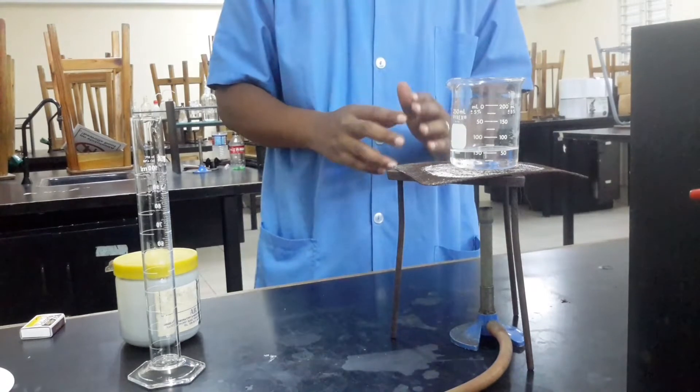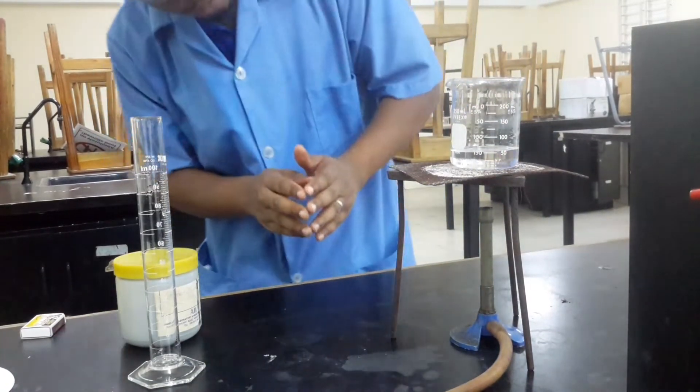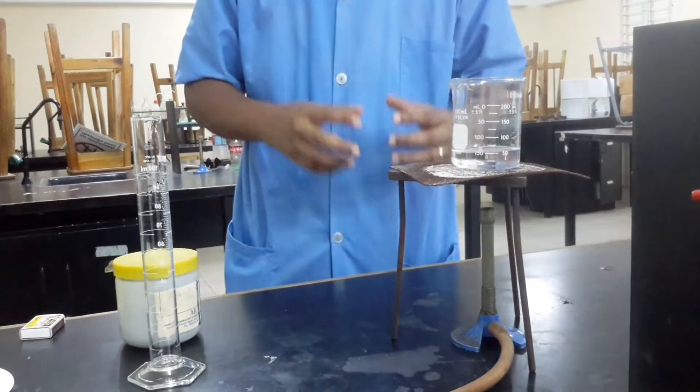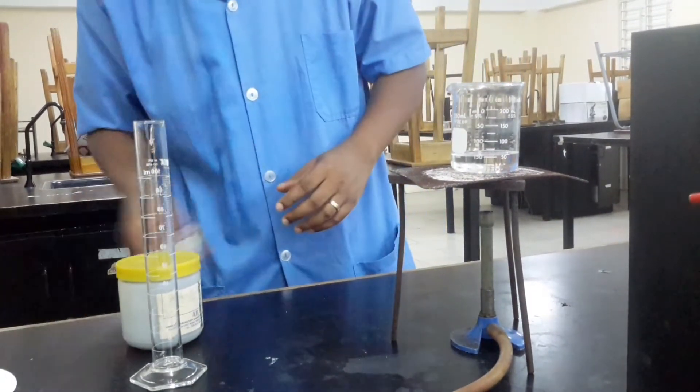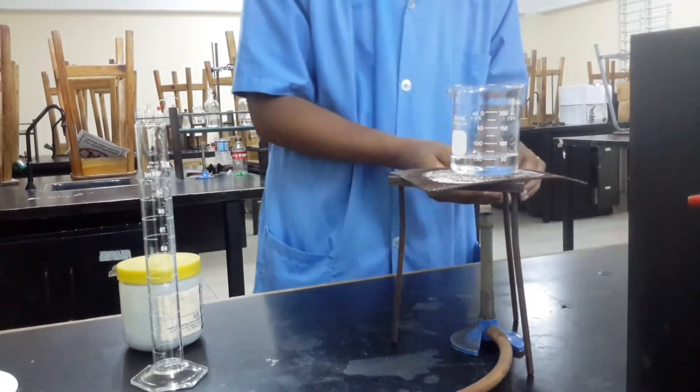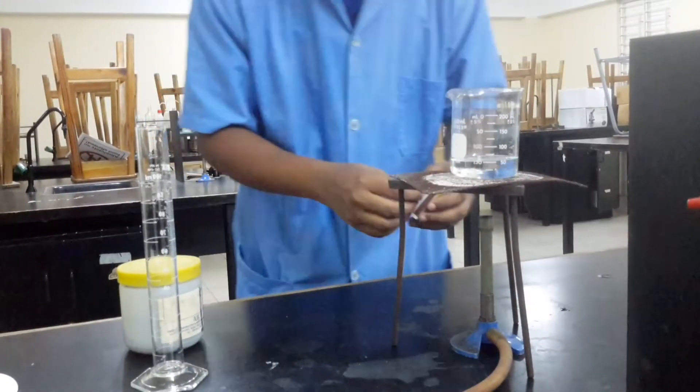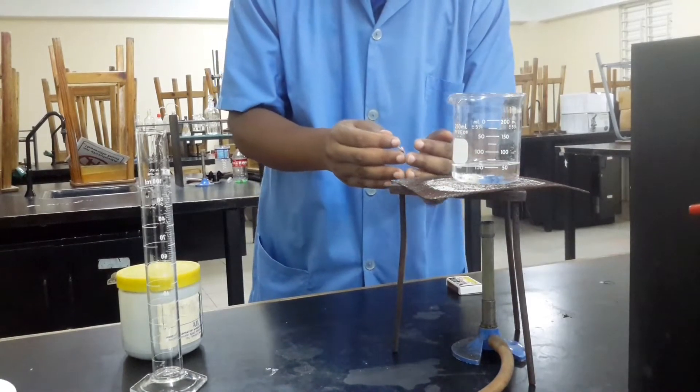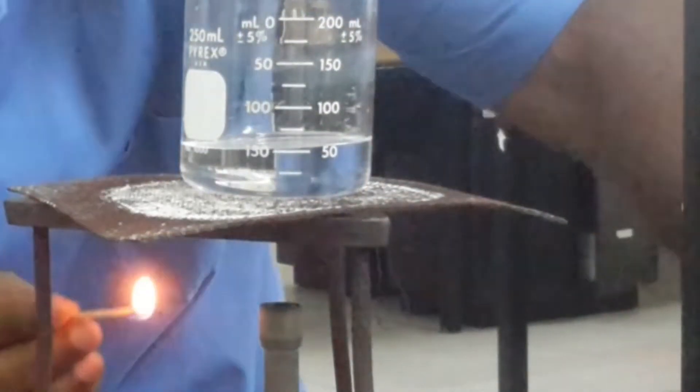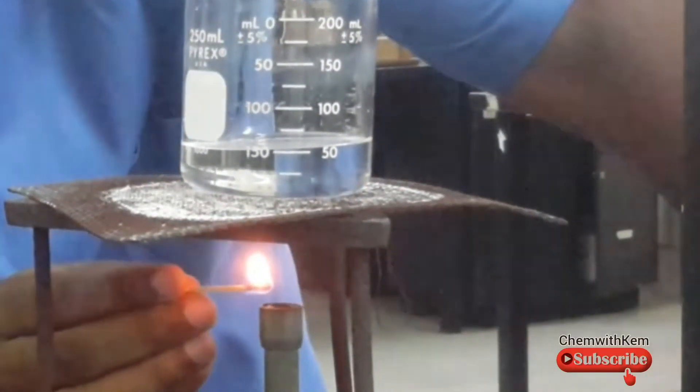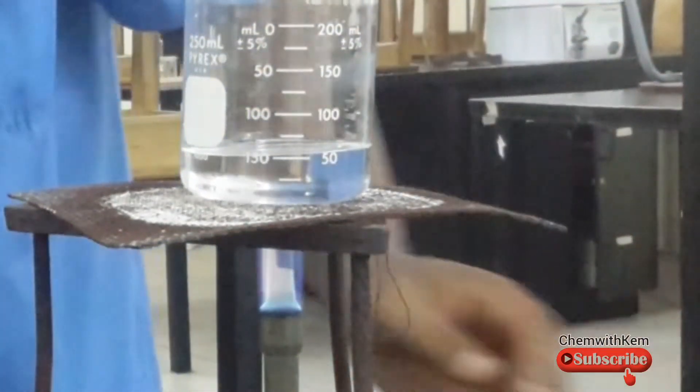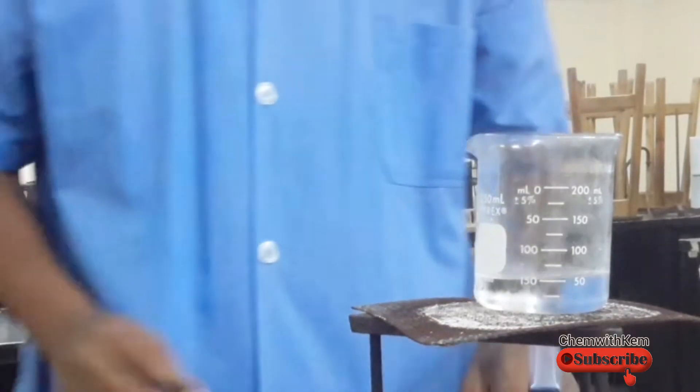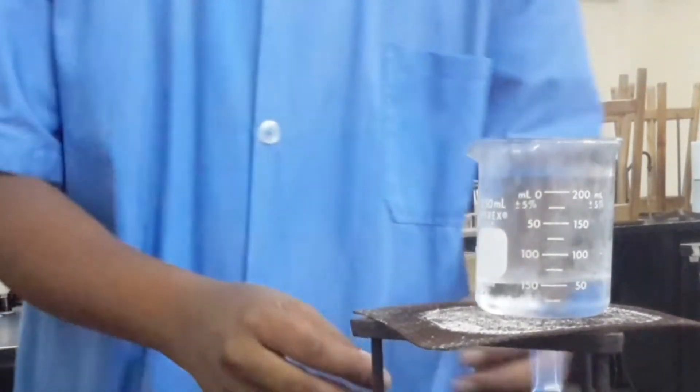Simply, hydration alone, hydration energy is not enough to break apart the copper oxide. So we'll have to encourage it by heating it. We'll start our flame or turn on the flame. The acid is being heated.